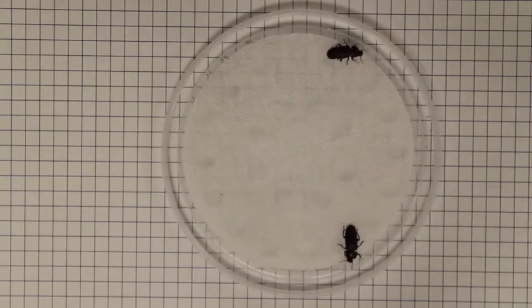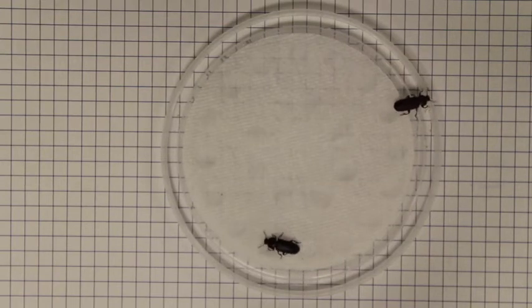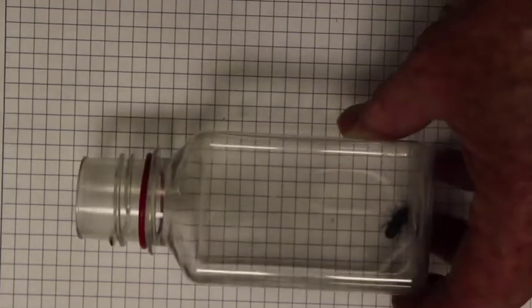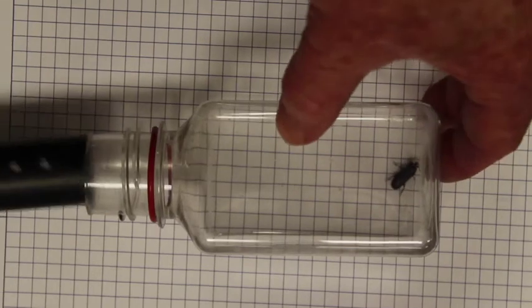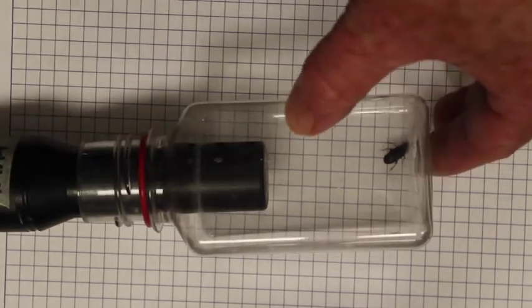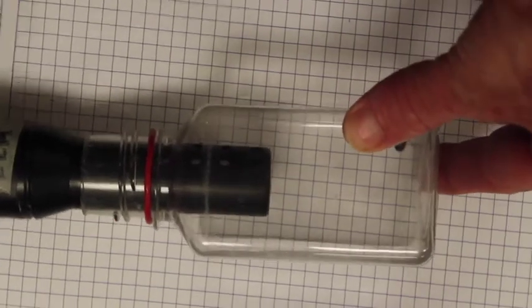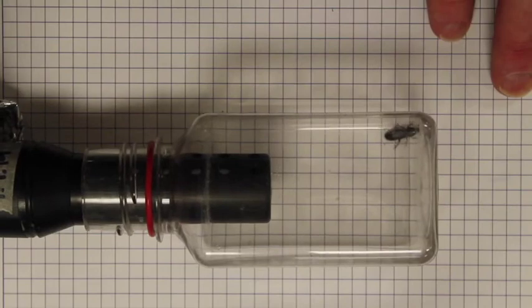So here are two of the beetles that we're going to use for this study. You can see they have a nice exoskeleton and they have legs, so they're able to crawl around with those legs. So I'm going to take one of these two and place it in the respiration chamber. Okay, and then we now have the beetle that we're going to get a measurement on, and we'll add the CO2 gas probe to this beetle so that we can get an estimate of respiration rate.